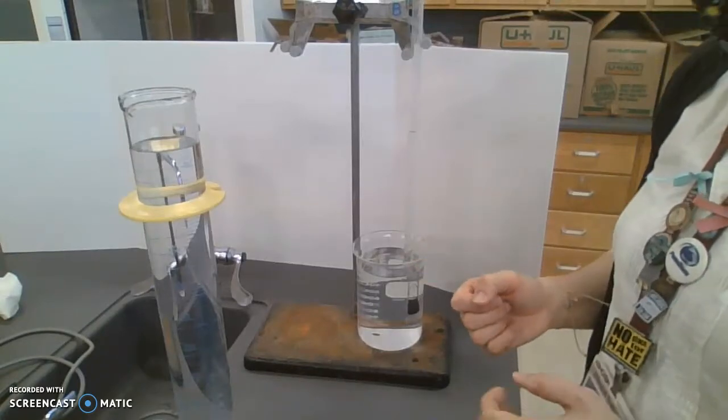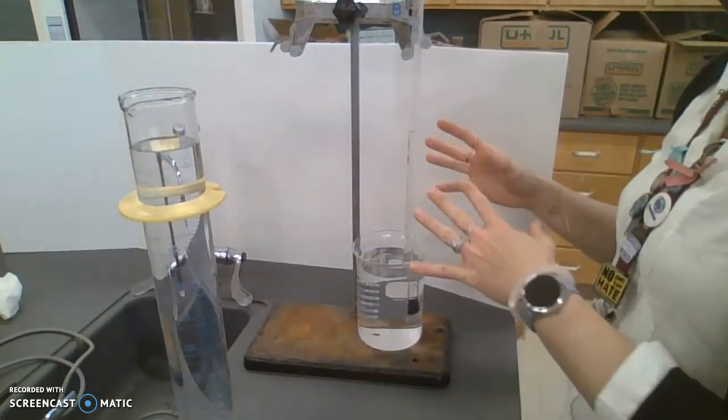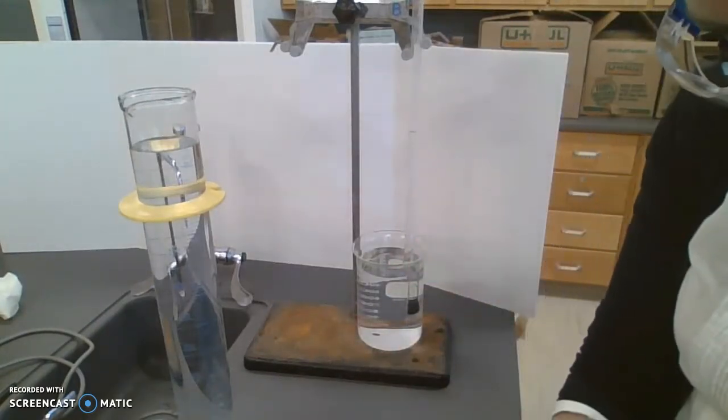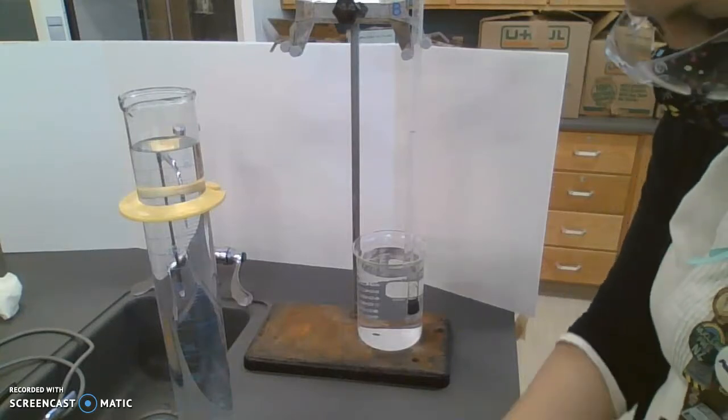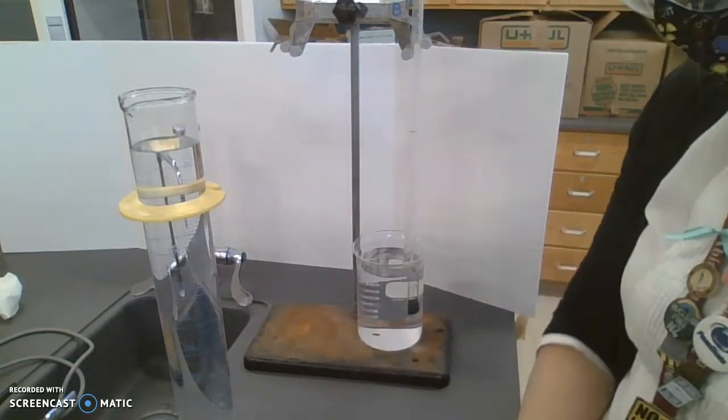All right. The five minutes has passed. We have waited for this to cool down to room temperature, which is our 23.4 degrees Celsius.